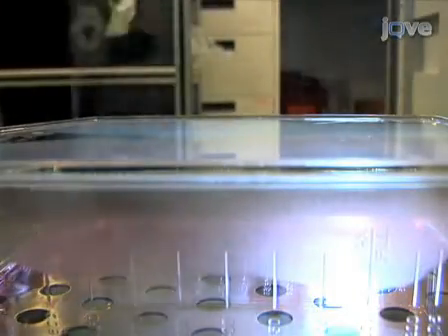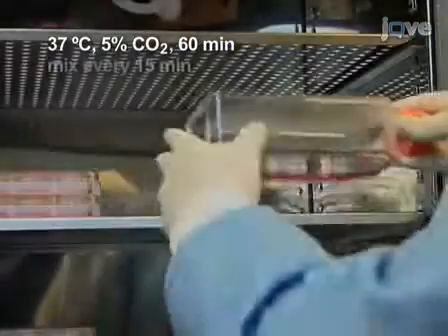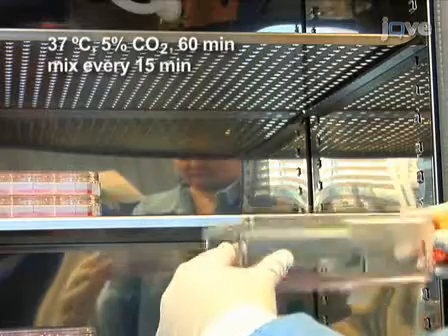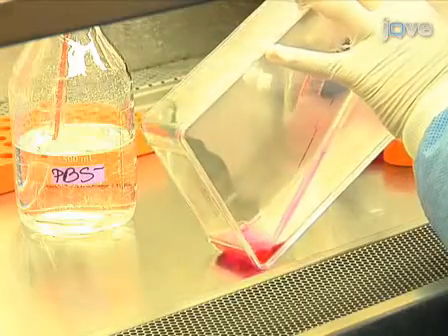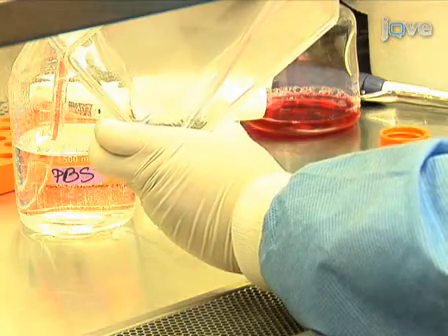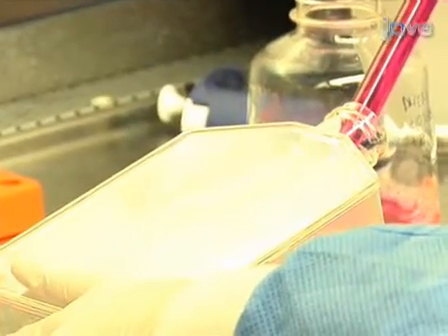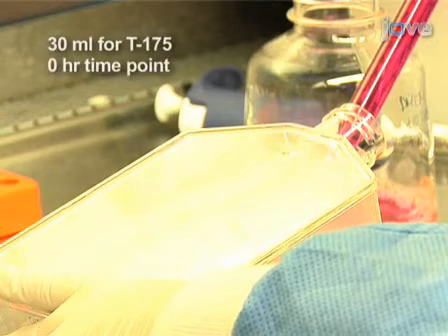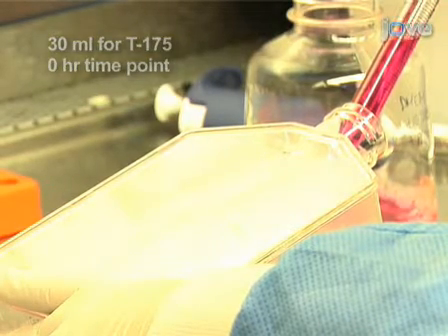Incubate at 37 degrees Celsius in a 5% CO2 incubator for 1 hour. Be sure to tilt and swirl the plates every 15 minutes to spread the virus uniformly and keep the cells moist. After incubation, remove the media containing the virus and rinse 3 times with room temperature PBS. Add the maximum amount of viral growth medium to each flask, for example, 30 milliliters of media for a T175 flask. You can start counting this as your 0-hour time point.